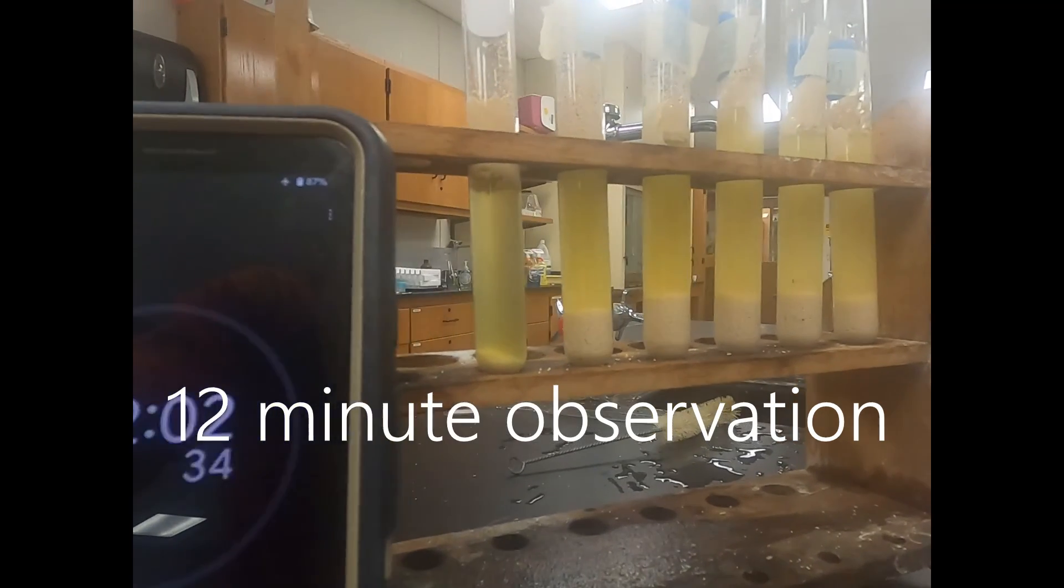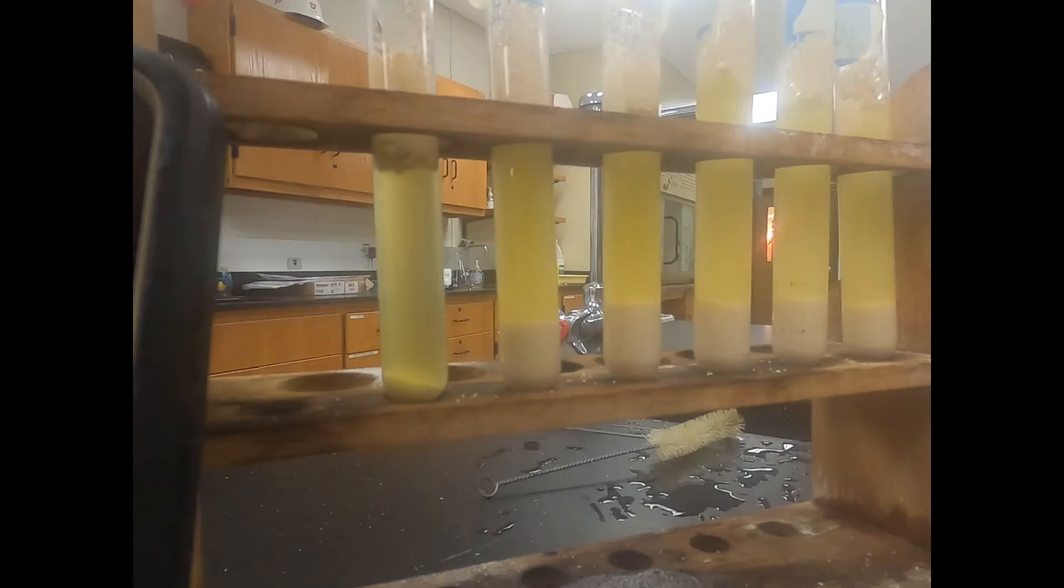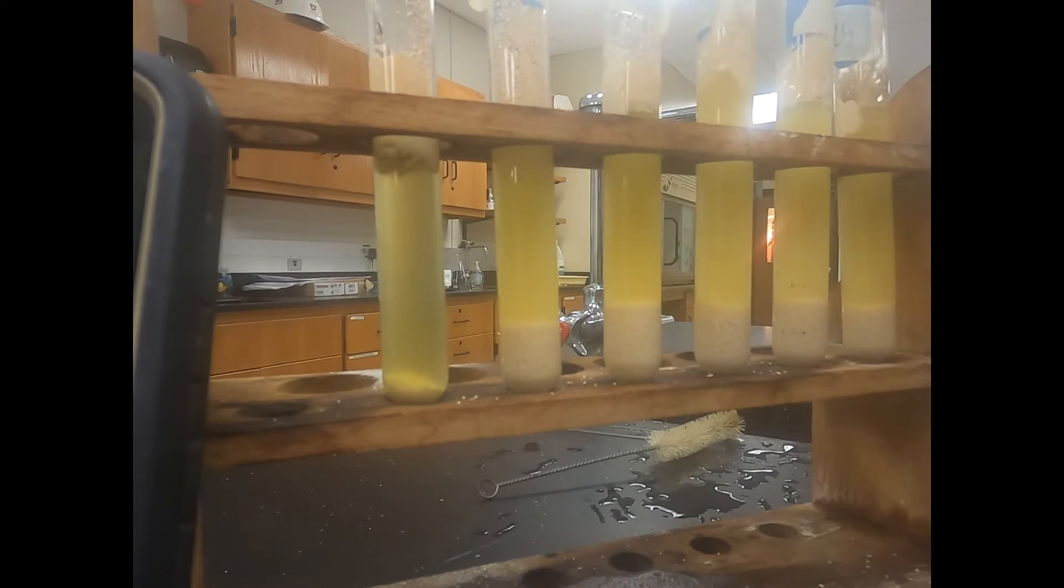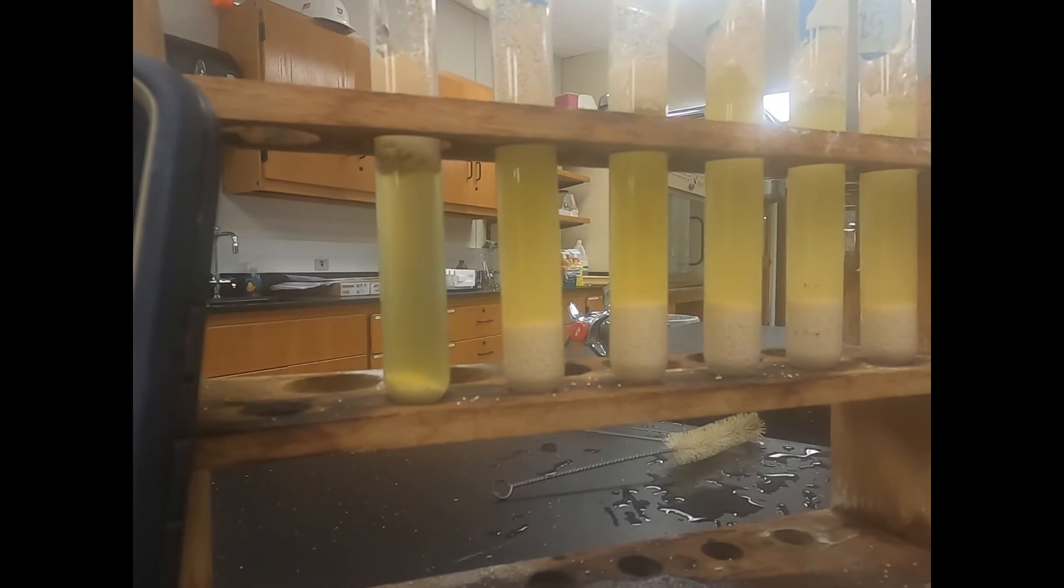Now we're at twelve minutes. Again we want to record our coloration starting at zero, working our way across to the twenty-five drops. We're looking at changes and differences in color between these different test tubes.